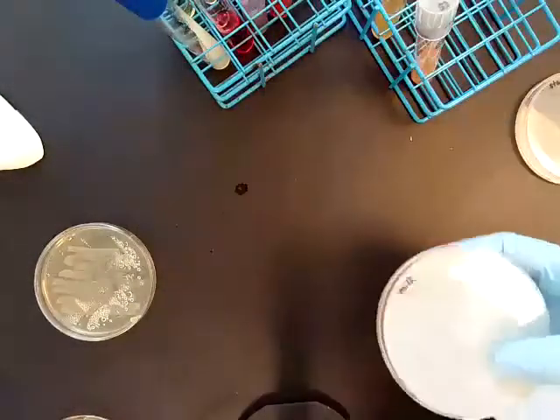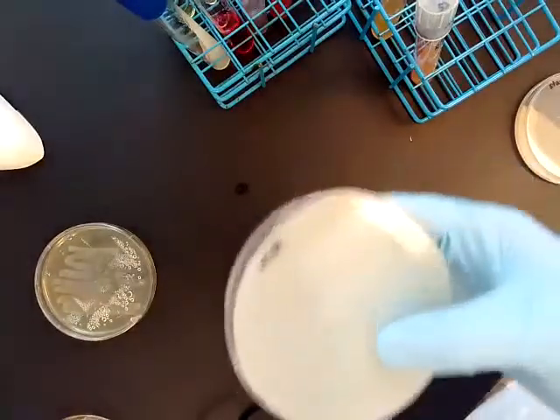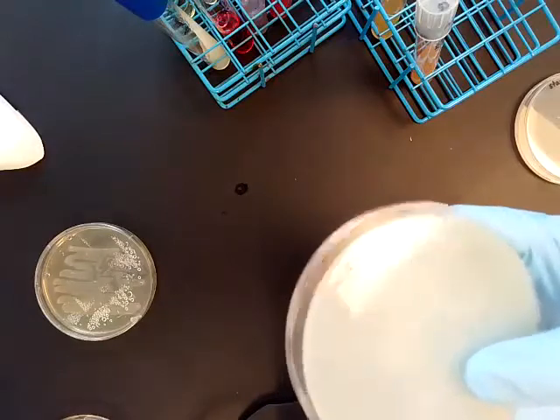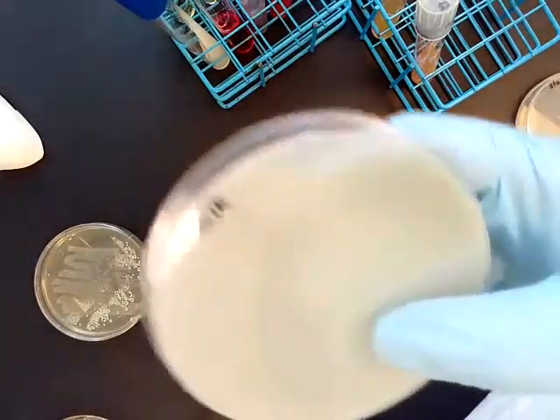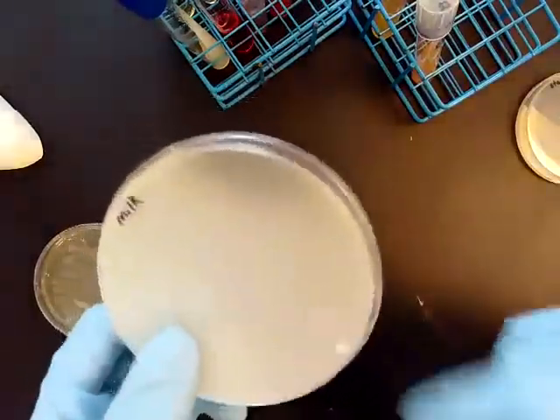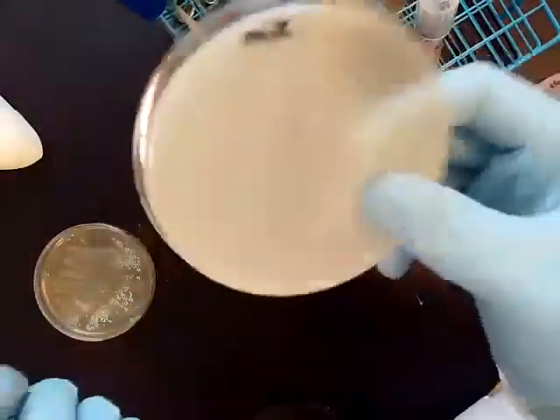Casein hydrolysis uses milk agar. Casein is a protein found in milk, and this test evaluates the microorganism's ability to produce proteases — enzymes that digest proteins. If they're able to digest the proteins in the milk, you're going to see a clearing around the growth.